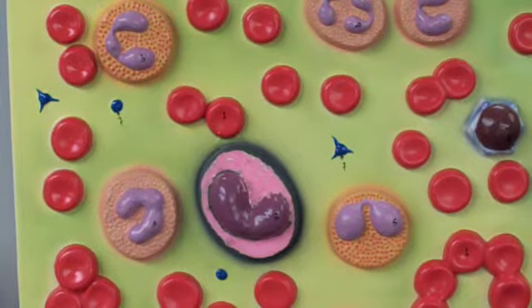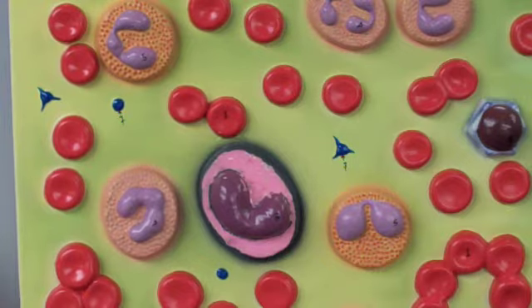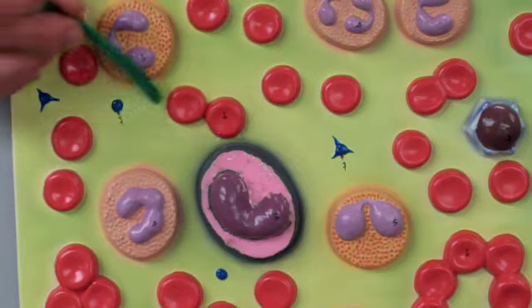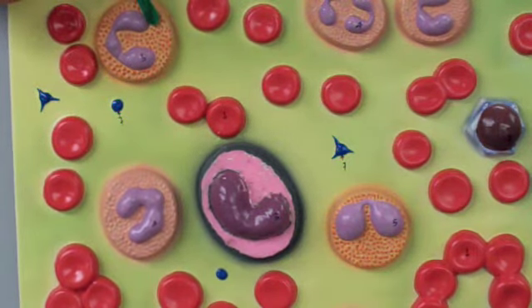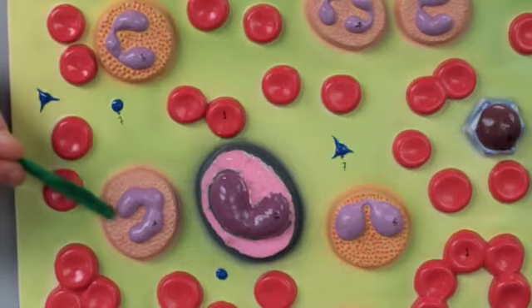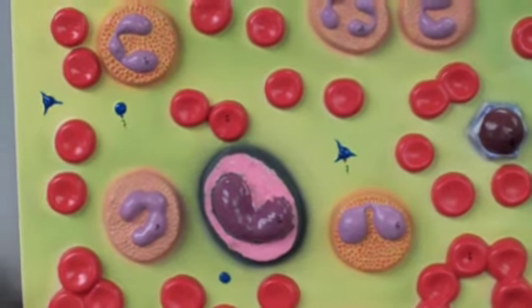And then as it comes to the white blood cells, we have two groups. We have granulocytes and agranulocytes. The granulocytes, when we stain them, they give us granules. Like here, these granules are reddish. They have granules too, but there's just texture, they're neutral. And these down here are bluish.